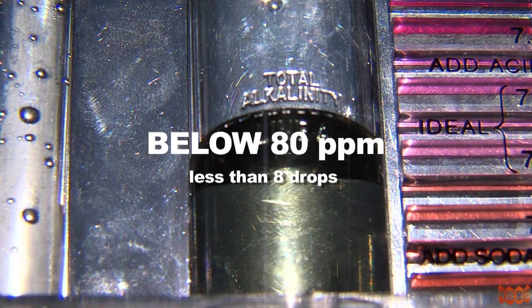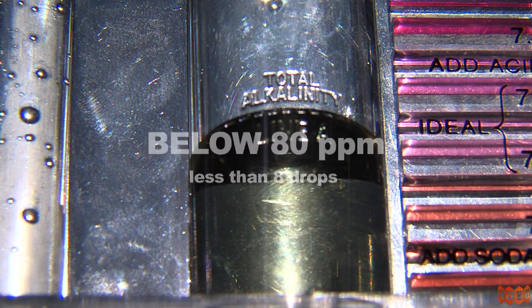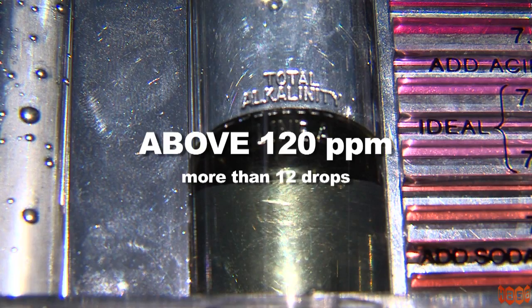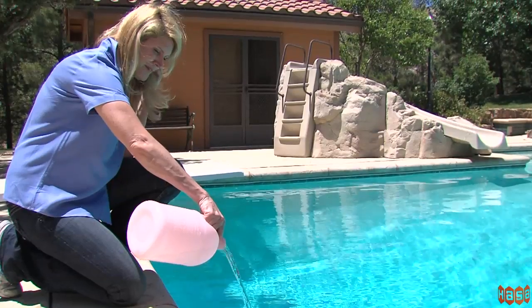If your reading is less than desired, add sodium hydrogen bicarbonate. If the reading is higher than desired, acid is usually needed.